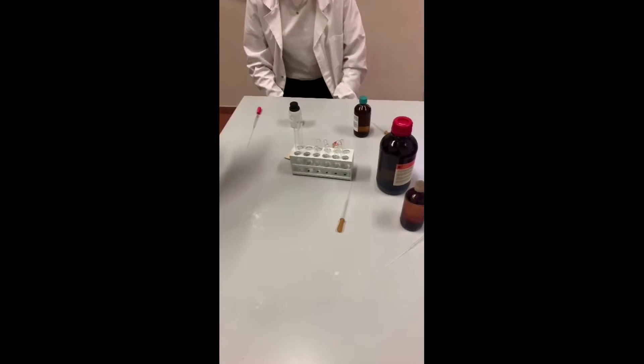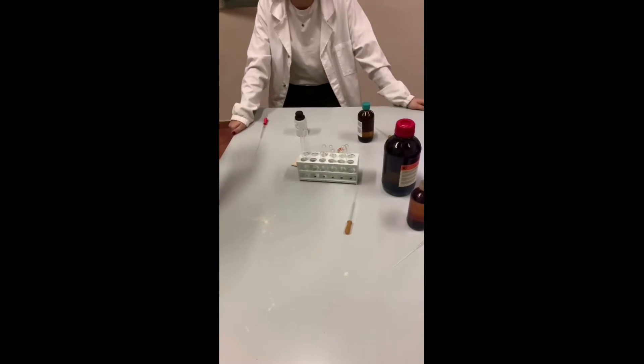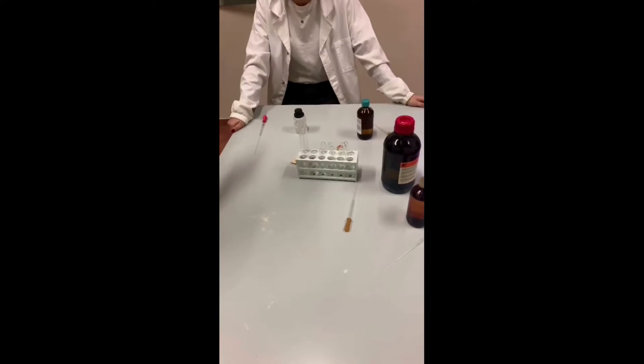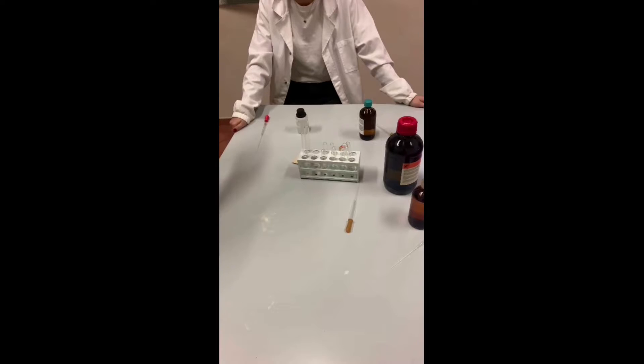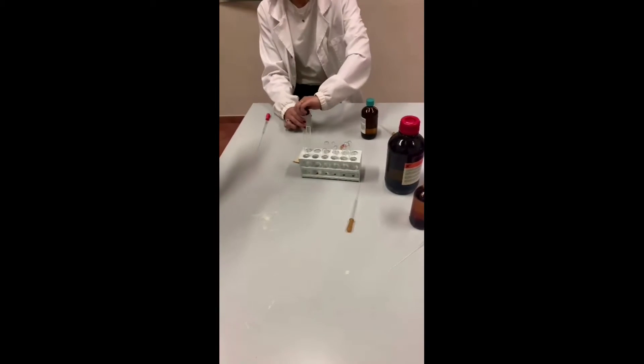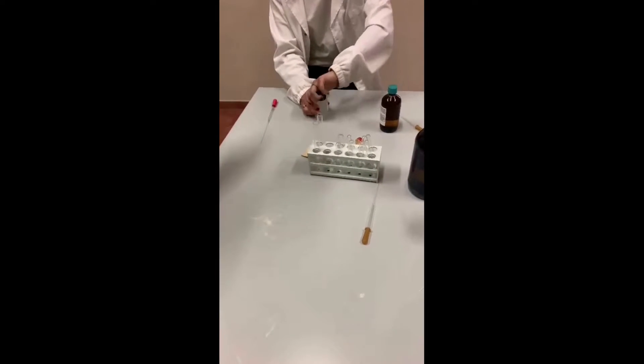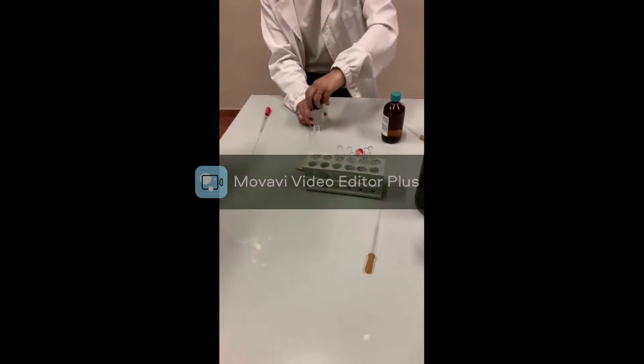In this experiment we synthesize chemicals that are normally present in fruits, and which give the aroma and fragrance. These chemicals are called esters. Let's start.